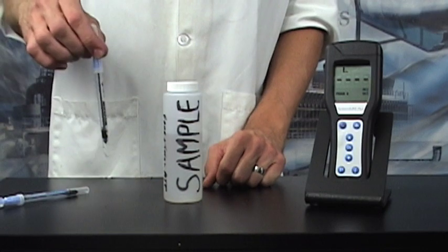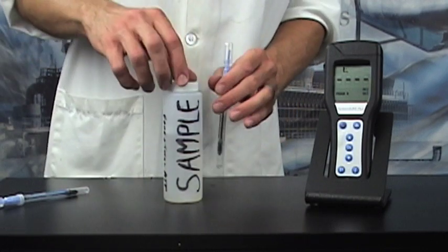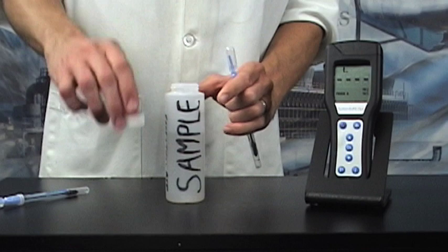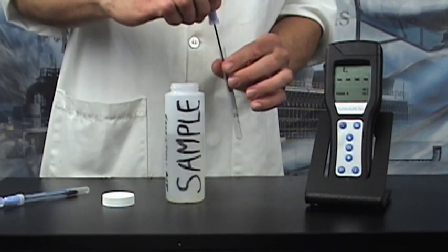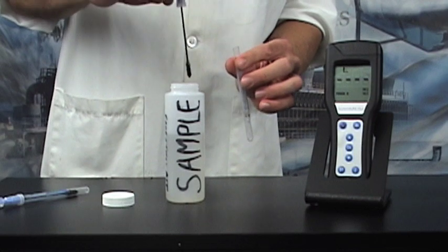Using ATP pens that have been warmed to room temperature for at least half an hour, pull out the pen from the protective covering and dip into water sample.